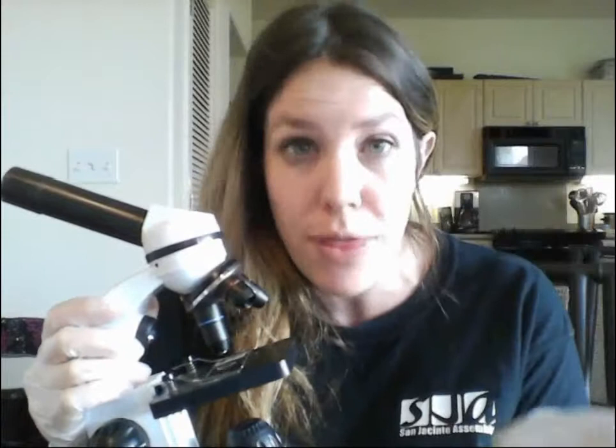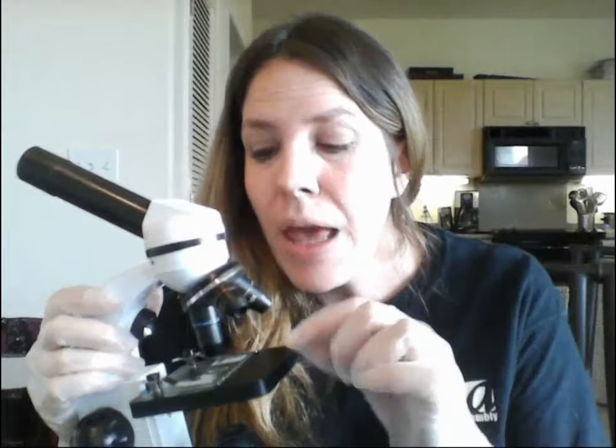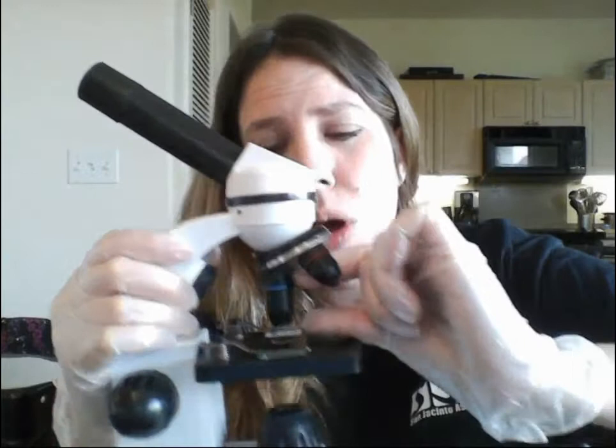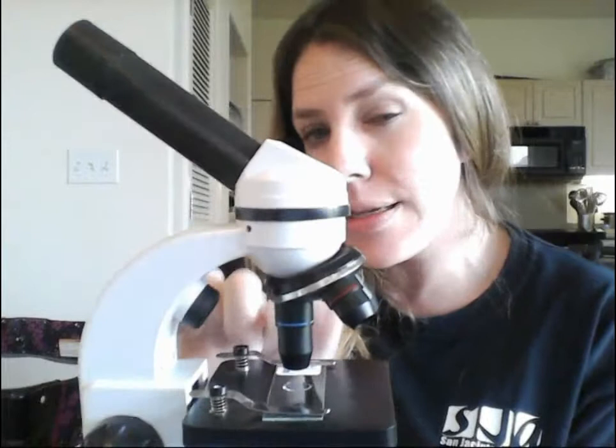Face-to-face lab microscopes usually also have a fourth objective called the oil immersion objective — a 100x objective giving 1000x total magnification — for looking at things like bacteria. It requires immersion oil: you put a little drop on the slide to cushion the distance between the objective lens and the specimen, because the oil immersion objective is so large it almost touches the specimen. Without oil it scratches the lens and slide. Fortunately, we don't have to worry about that — our highest is the 40x objective.